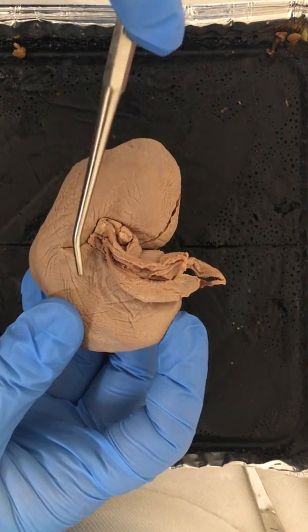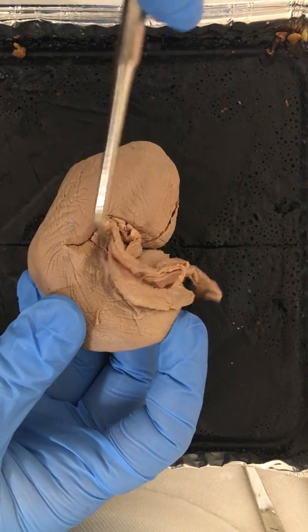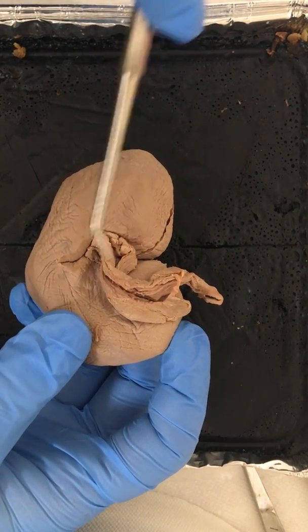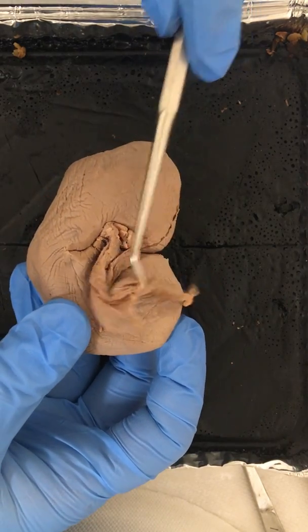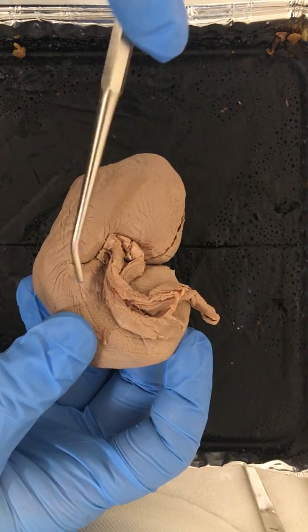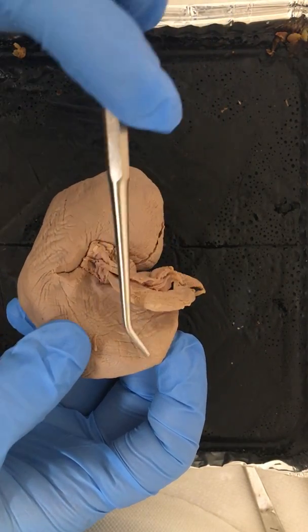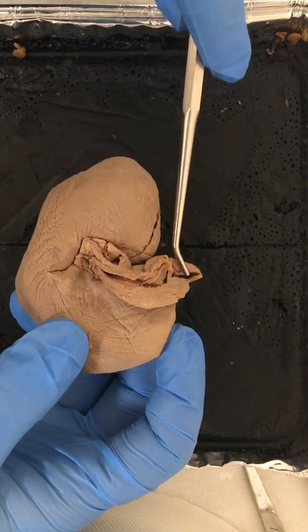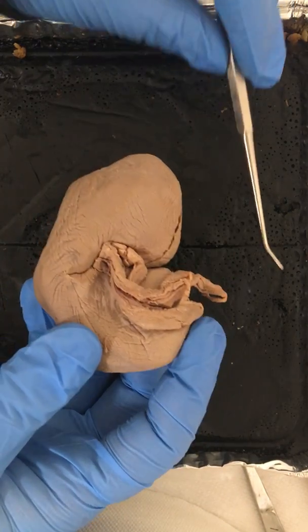The renal artery and the renal vein are difficult to see in this particular specimen, but with the renal artery and with the vein, this is where the blood is transported back and forth throughout the body. If we remember again, the artery comes from the abdominal aorta, and that supplies the kidney with oxygenated blood. The renal vein, however, is the blood vessel that will carry filtered deoxygenated blood out into the inferior vena cava. We also have the ureter. Again, that's the tube that will connect the kidney to the urinary bladder.